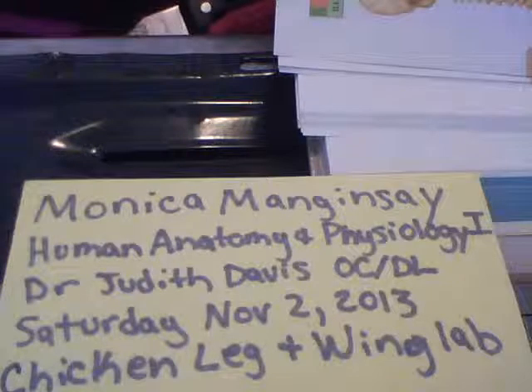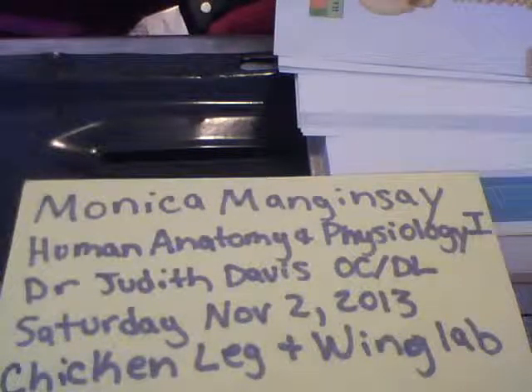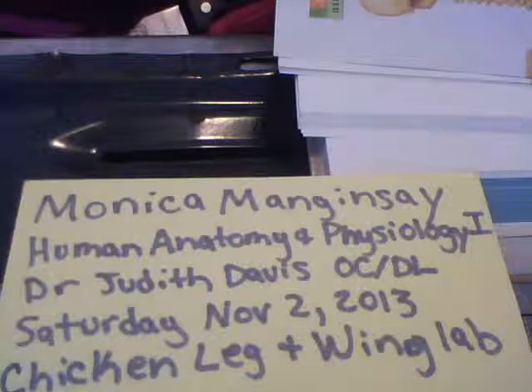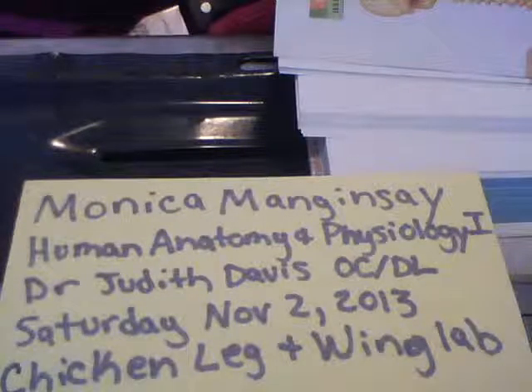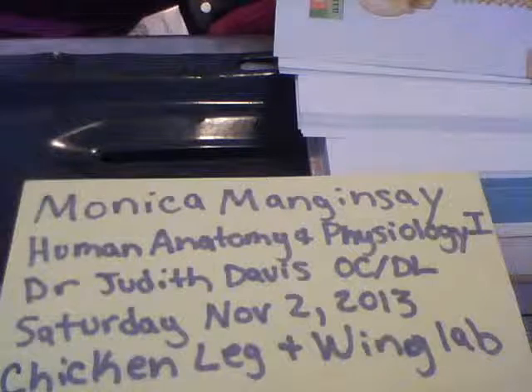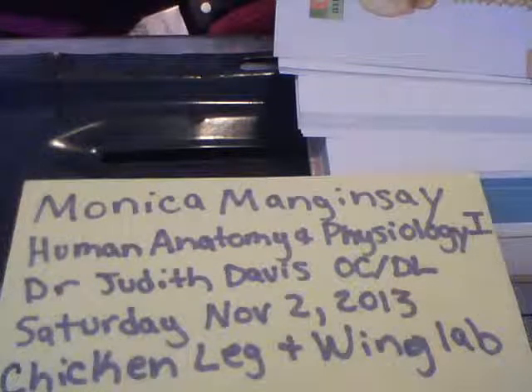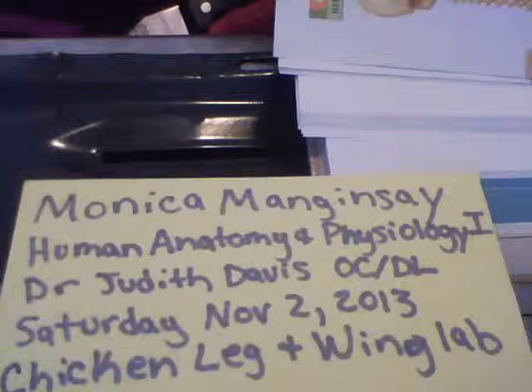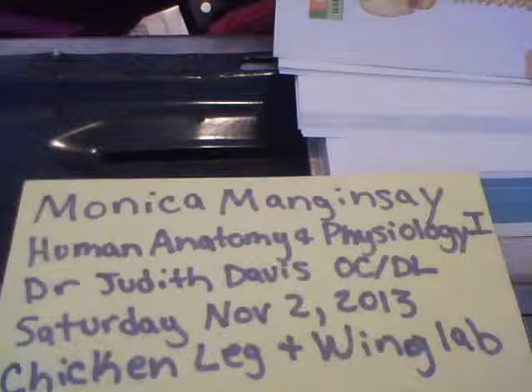Ligaments. The capsules and ligaments of synovial joints unite the bones and prevent excessive or undesirable motion. As a rule, the more ligaments a joint has, the stronger it is. However, when other stabilizing factors are inadequate, undue tension is placed on the ligaments and they stretch. Stretched ligaments stay stretched, like taffy, and a ligament can stretch only about 6% of its length before it snaps. Thus, when ligaments are the major means of bracing a joint, the joint is not very stable.